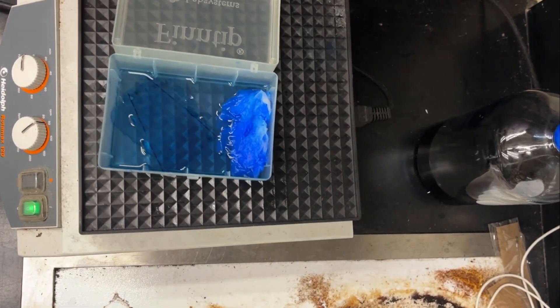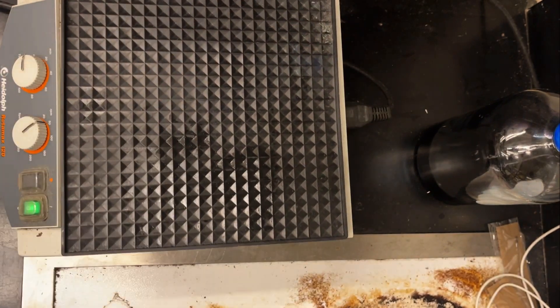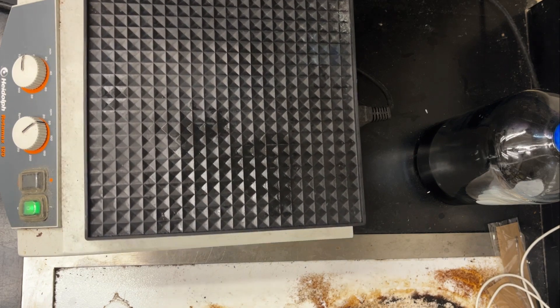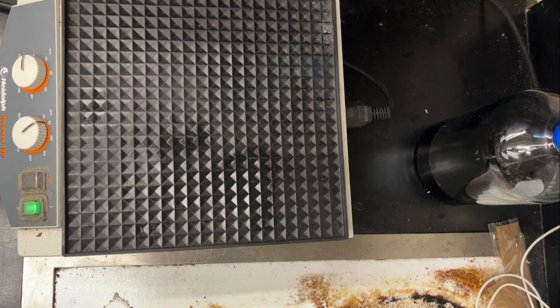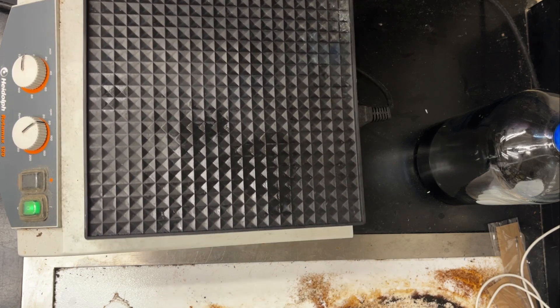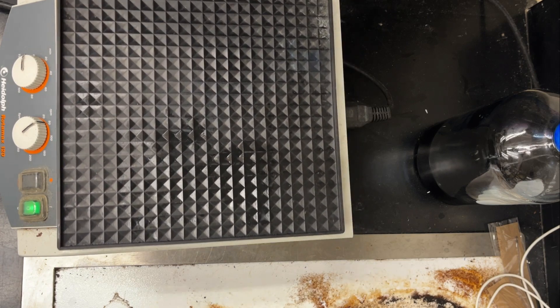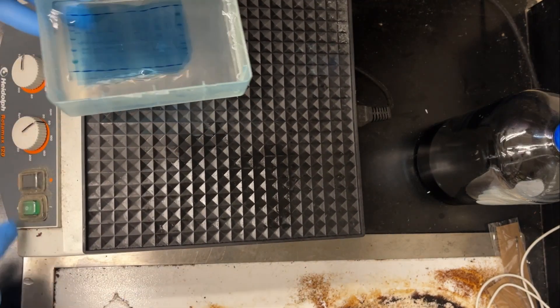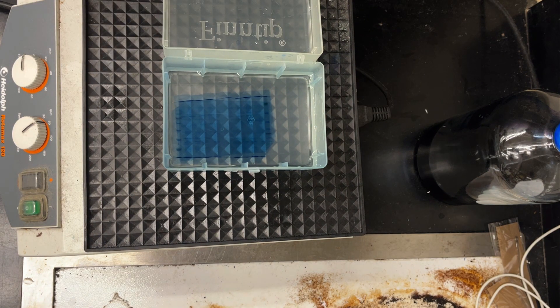And I'm back. So it's been about four hours now. Class kind of kept me busy. But gel is pretty much ready to go. So I'm going to now change it out. Sometimes what happens if you leave it in the decolorizer too long, your gels shrink as the water gets drawn out, so it helps to hydrate. So I poured it out, give it a little distilled water rinse a couple times. And then I'm just going to float it in distilled water and just let it soak. But look at the gel when I put it back. You can see the protein bands on the gel.